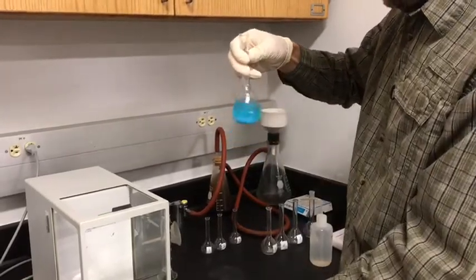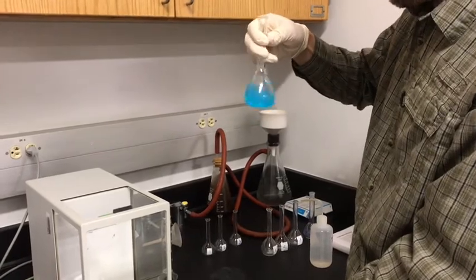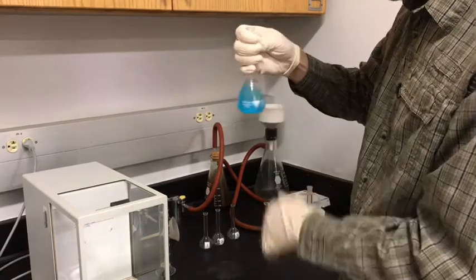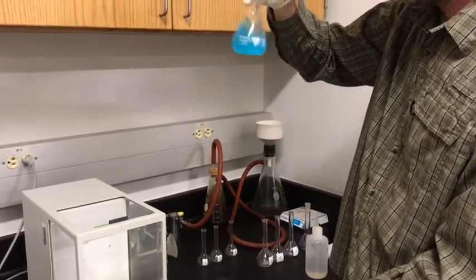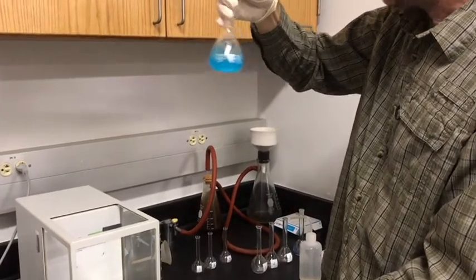And we'll just make sure we get this all fully dissolved. This may take a little while.